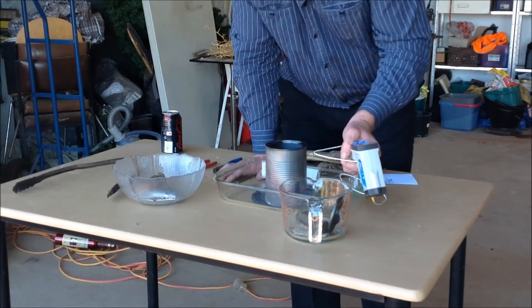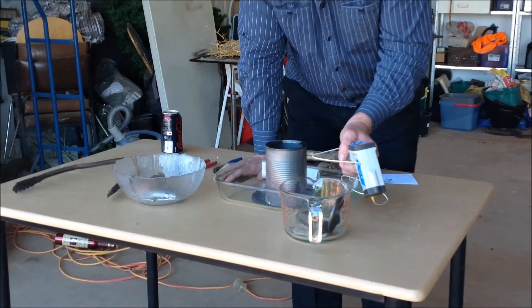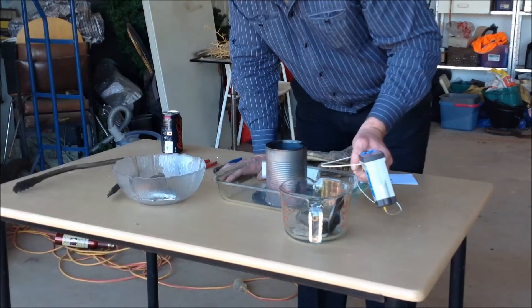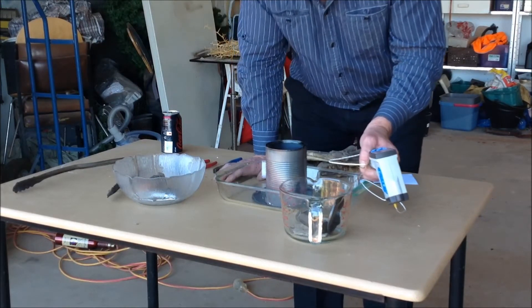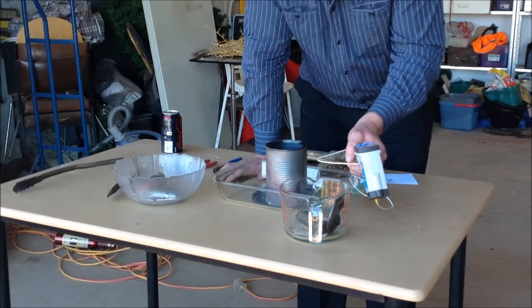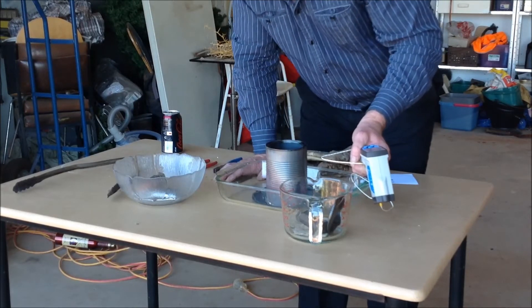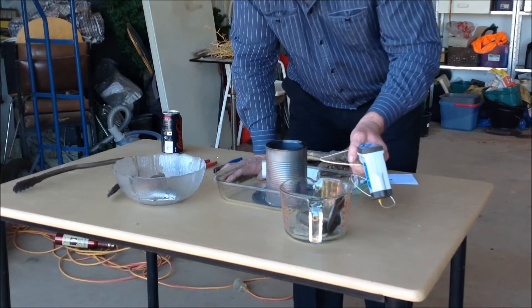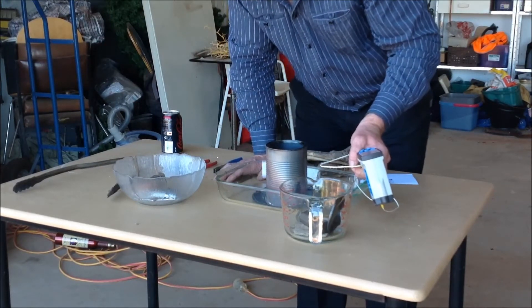430, 266.4. 420, 266.05. 410, 265.64. 400, 264.97.